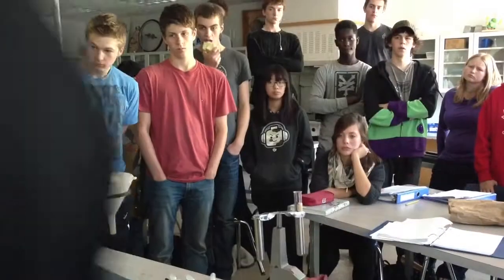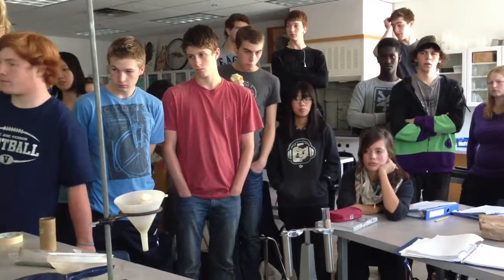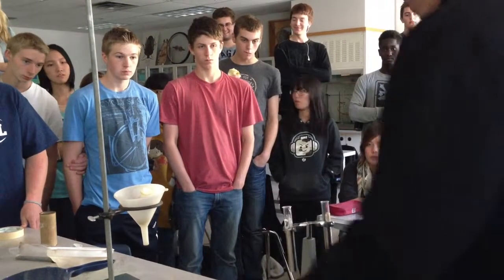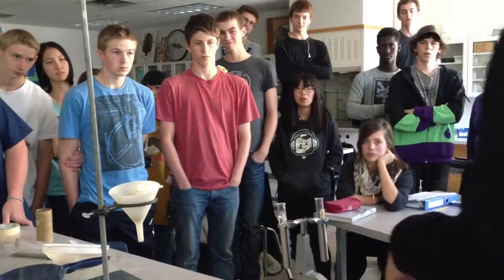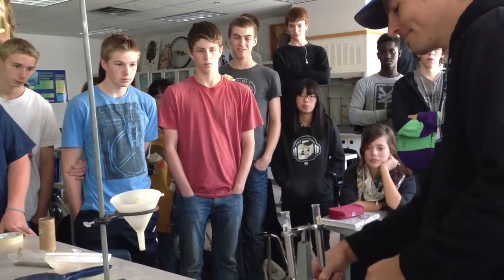Instead, I'm going to stick it in here, which spins really, really fast. And one of the only times I've sworn in class was when it was at top speed, and then my thumb came up and it whacked me in the thumb. It was awful. I'll try not to do that today.